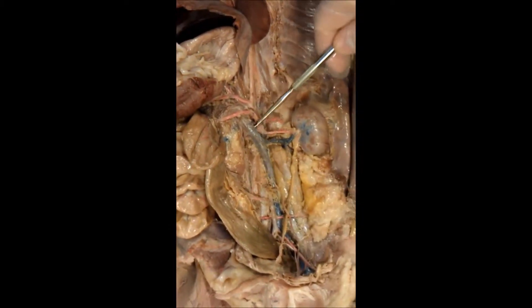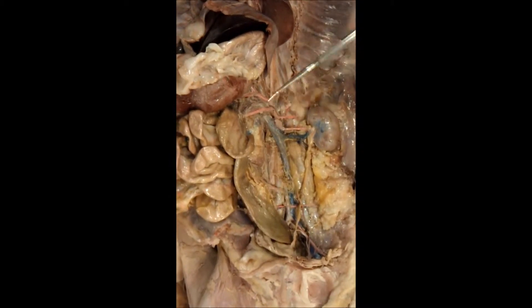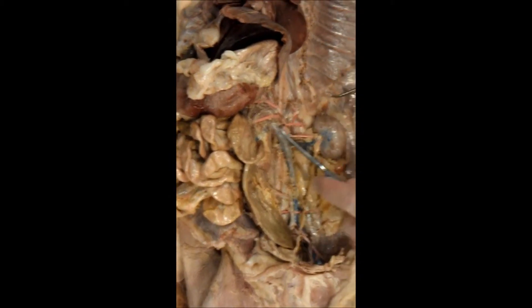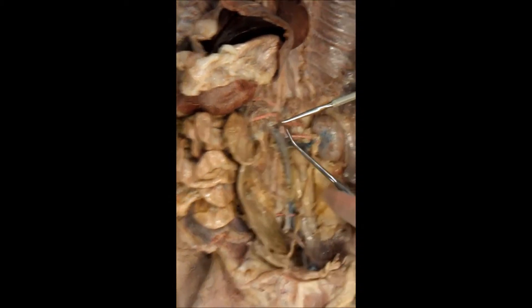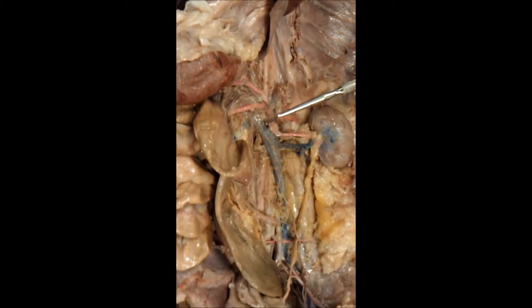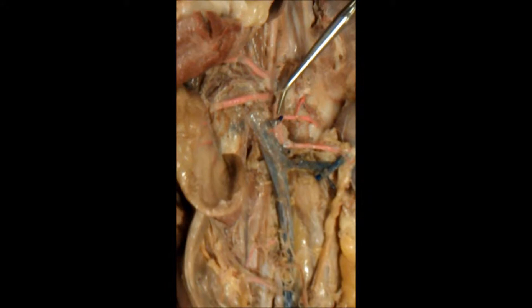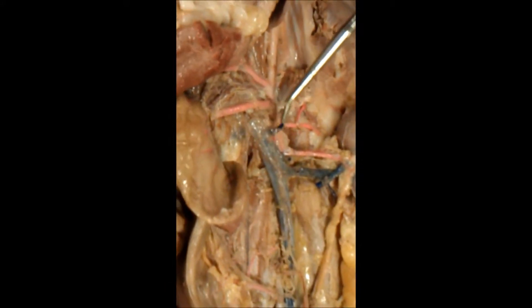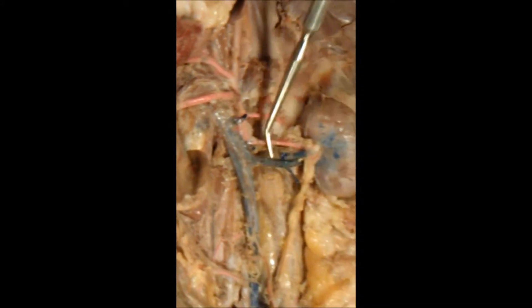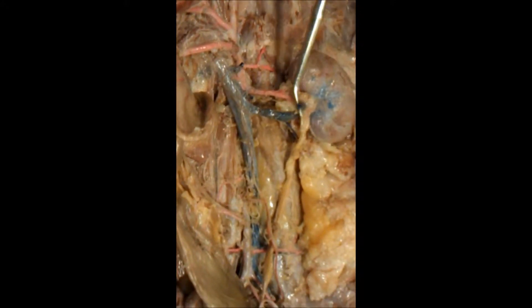Inferior of the heart, you have this is still the inferior vena cava. Then off of it, you have a suprarenal vein. That's a suprarenal vein. And then you have two renal veins, right here and right here.